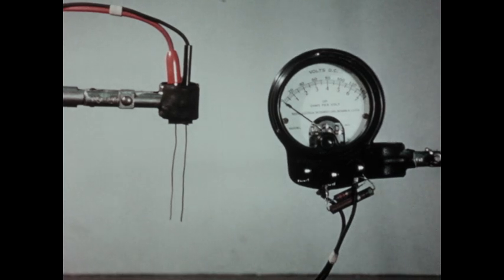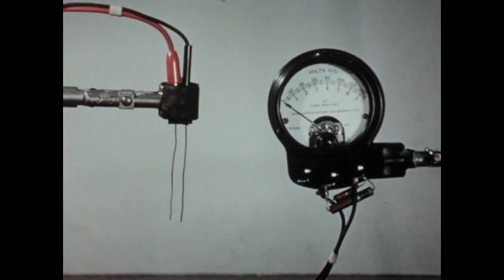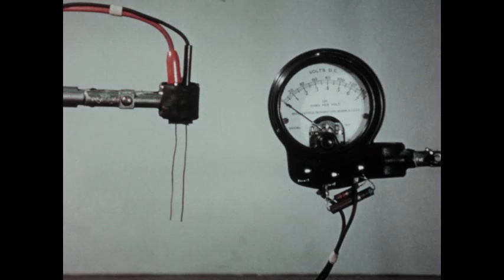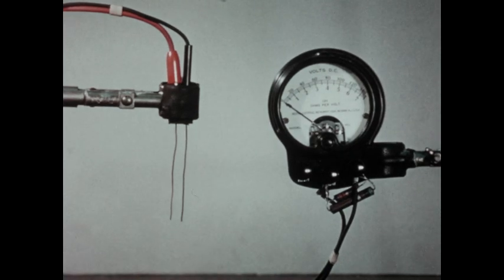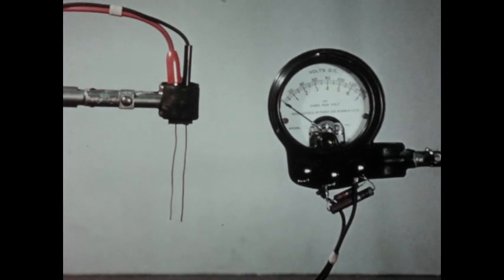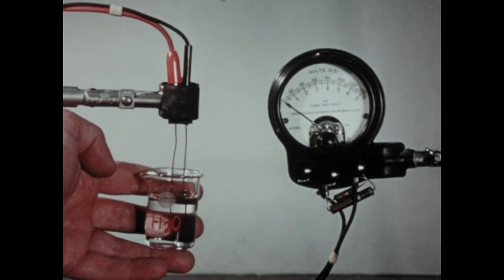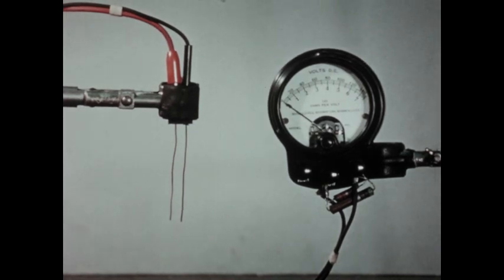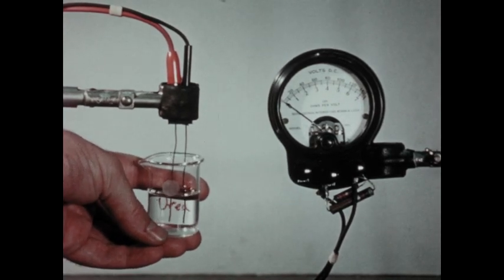The apparatus you see has been adapted to show roughly the conductivity of several different solutions. The calibrations on the instrument on the right simply indicate the extent to which the solution being tested conducts the electric current. These two small copper wires are connected to a source of direct current. We see that essentially no current is flowing between the two copper electrodes. Next, we'll test the conductivity of a urea solution similar to the one used in the boiling point experiment, and again we observed no conductivity.